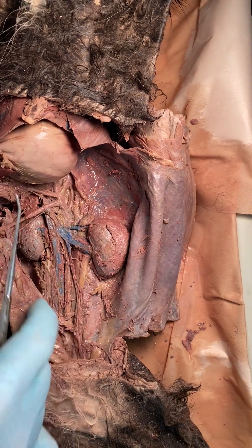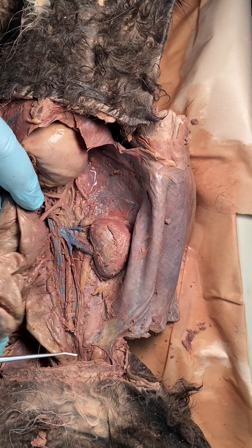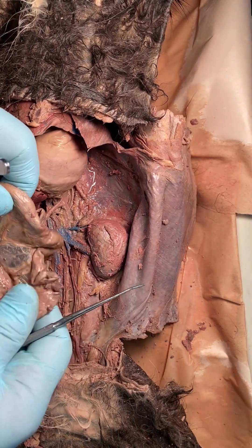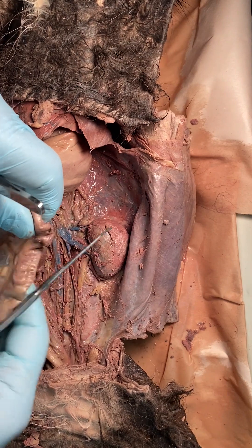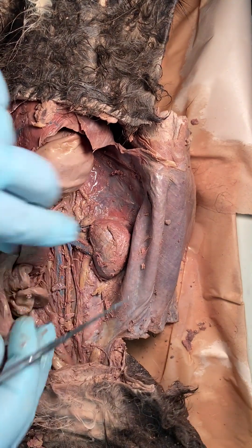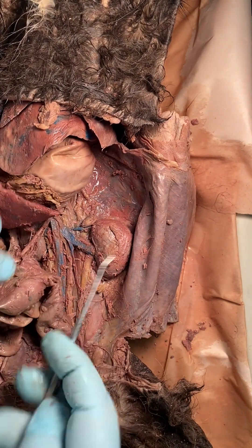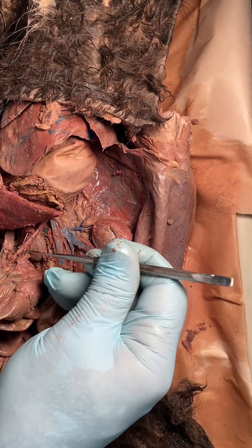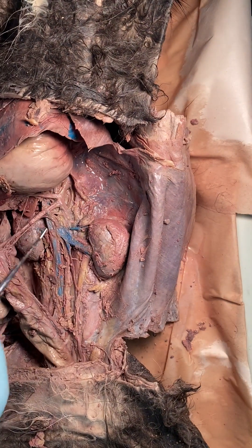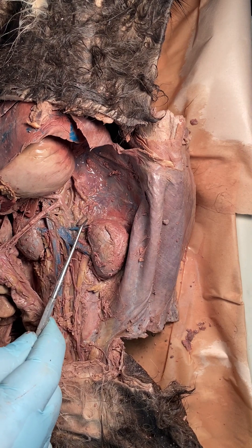That's celiac trunk. The next branch should be the superior mesenteric, and there it is. If I move the colon up and out of the way, you can see it's going to the mesentery proper — you can see all the blood vessels in there. It's underneath the colon heading straight toward the mesentery proper, so that is the superior mesenteric artery.